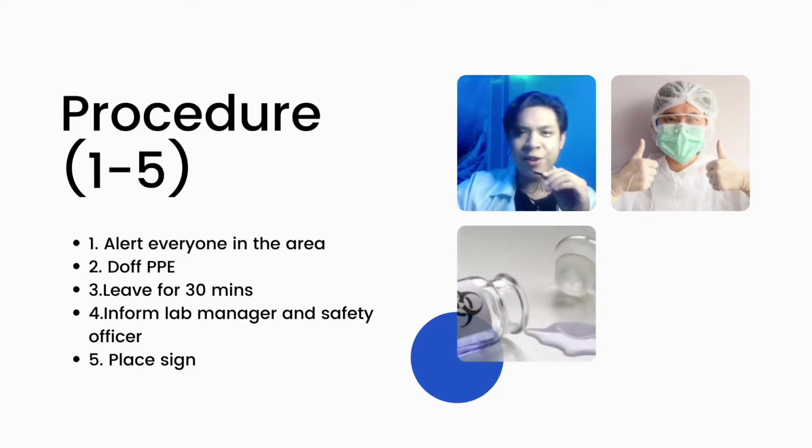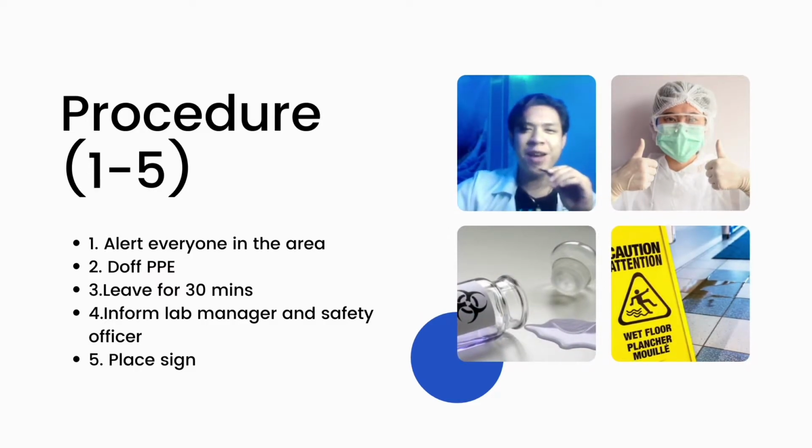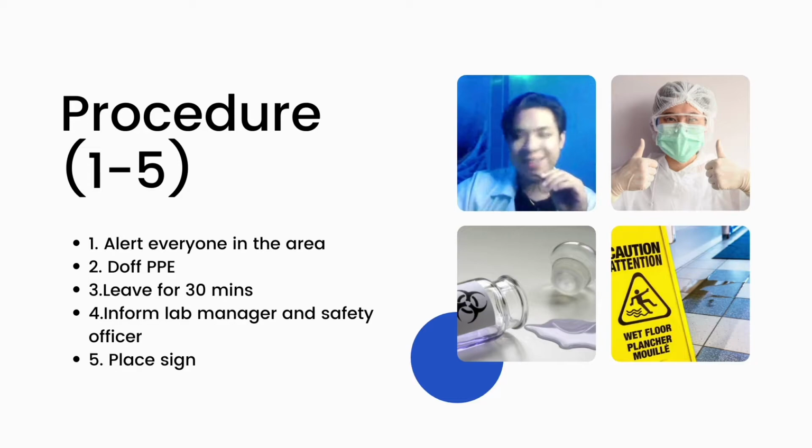Imagine this. You're in the laboratory. Then a spill happens out of nowhere. It doesn't matter if it's a reagent or a sample. Here are the first 5 steps in a spill drill. Take note, you could always pause the video at any moment if you want to take a closer look, it's okay. But one important reminder here is to always place a sign to avoid further injury for you and to other people in the laboratory.